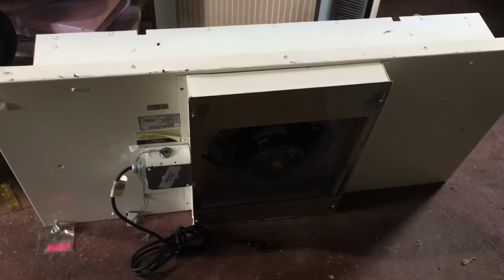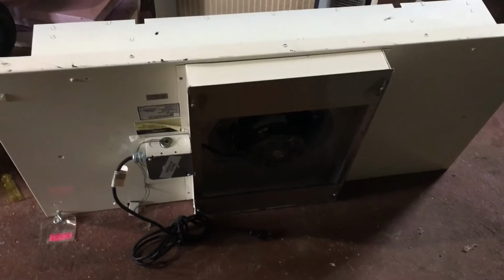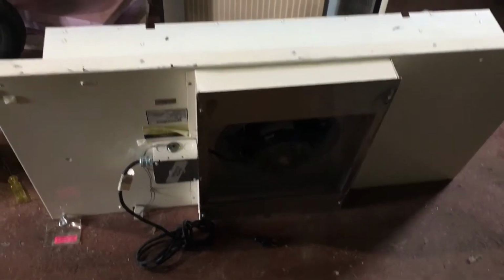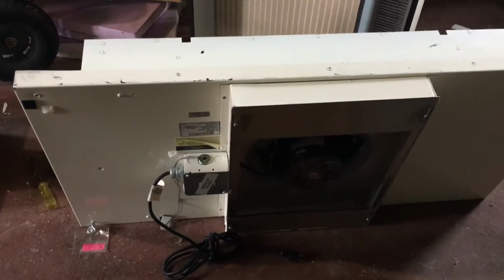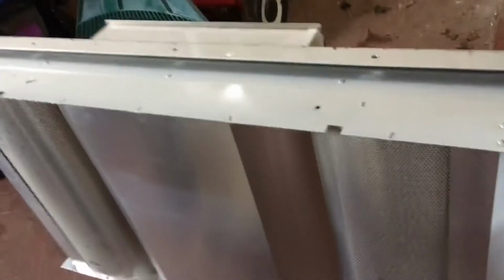This is the modular HEPA filter that you posted, that you found. I got one myself and decided to take it apart. Interesting. There's a baffle on the inside, and it's pretty gnarly in there. I ran my fingers across the screen there.